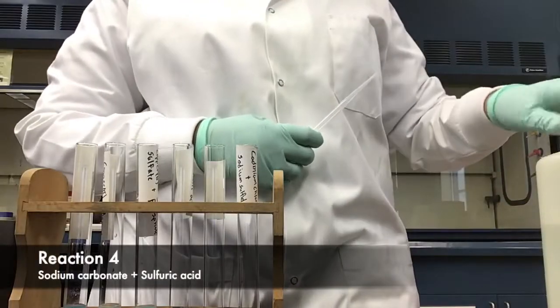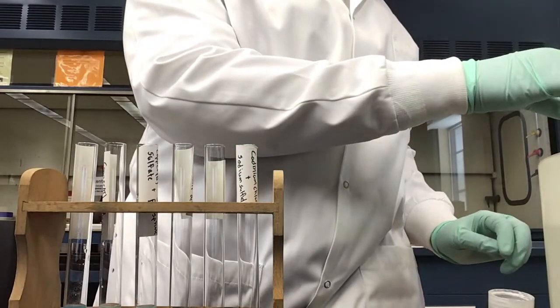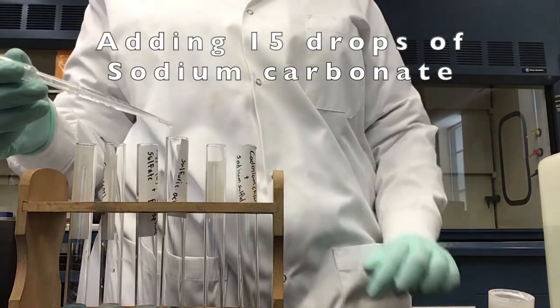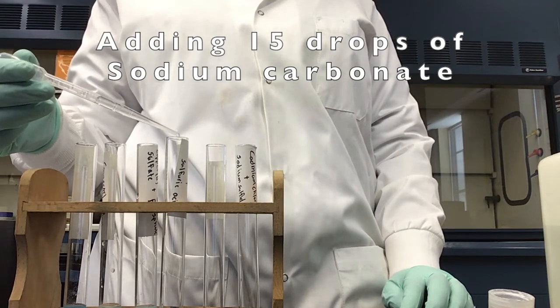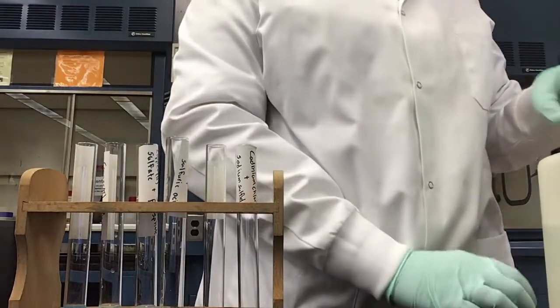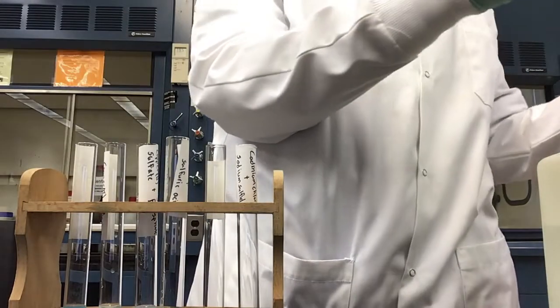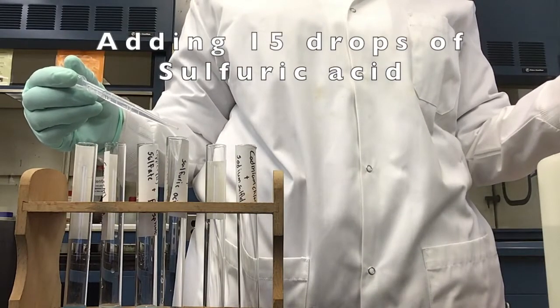Our fourth reaction today is sodium carbonate and sulfuric acid. We're going to start off with 15 drops of sodium carbonate to our fourth test tube. And now that we've added our sodium carbonate, we're going to add 15 drops of sulfuric acid to our fourth test tube.